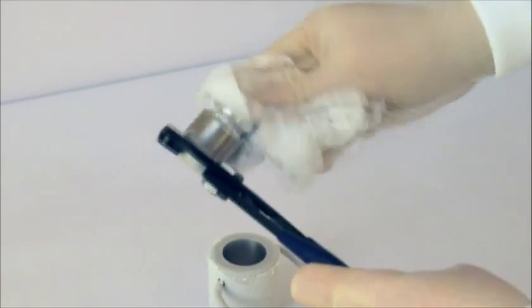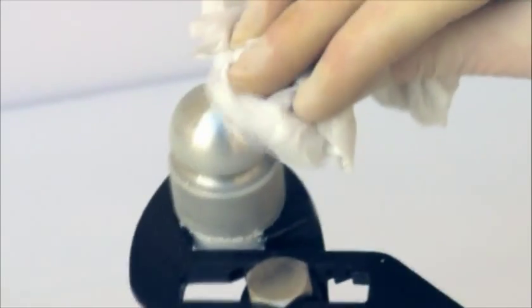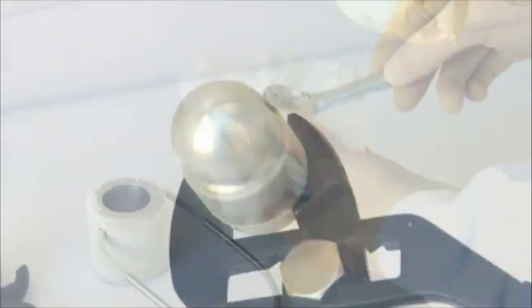The Cell Crusher can be cleaned at low temperatures without water. The handling pliers allows a firm grip on the piston, while the chamber is cleaned with the aid of the recovery spoon.